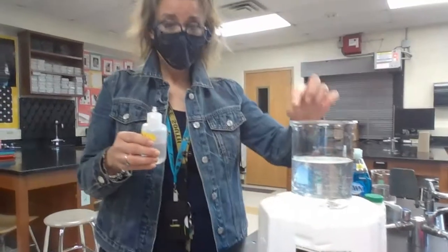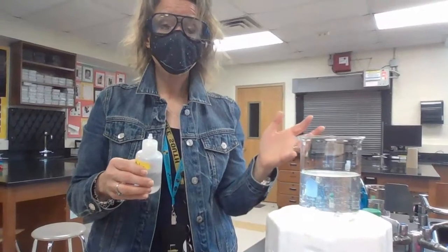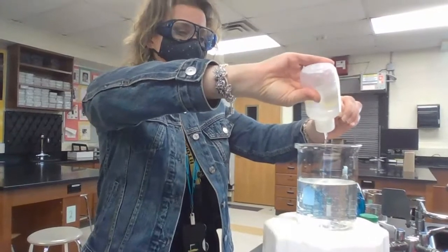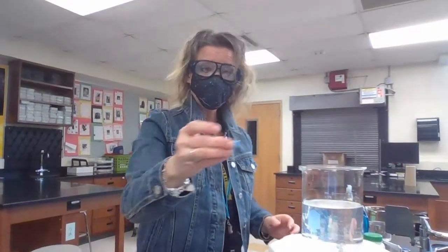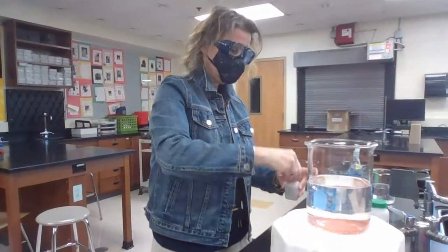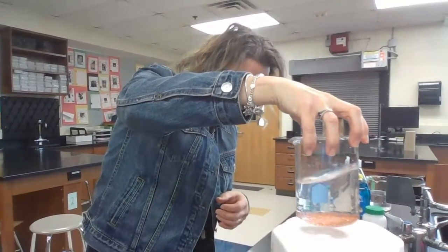Now look, potassium had a really big reaction, and then calcium had a reaction that was a little bit smaller. Think in your mind, what do you think is going to happen with the copper? Is it going to have a bigger reaction than calcium or a smaller reaction than calcium? So let's put our phenolphthalein in here again. So again, no color change right away. All right. And now let's add our copper. All right, so it went right to the bottom. It did. And waiting for something to happen. Still waiting.